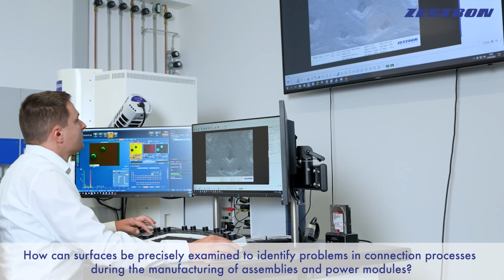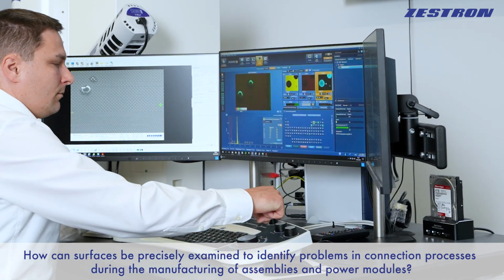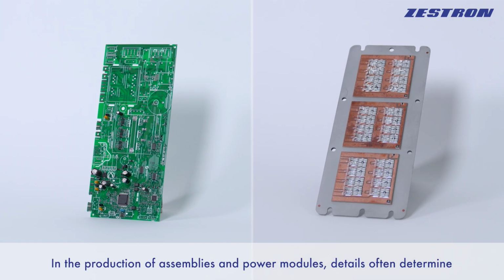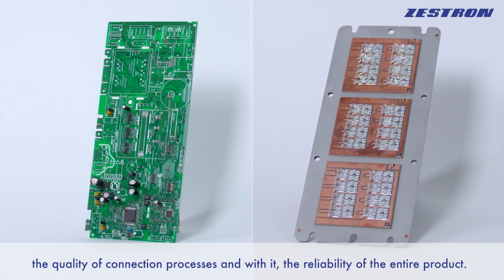How can surfaces be precisely examined to identify problems in connection processes during the manufacturing of assemblies and power modules? In the production of assemblies and power modules, details often determine the quality of connection processes and, with it, the reliability of the entire product.